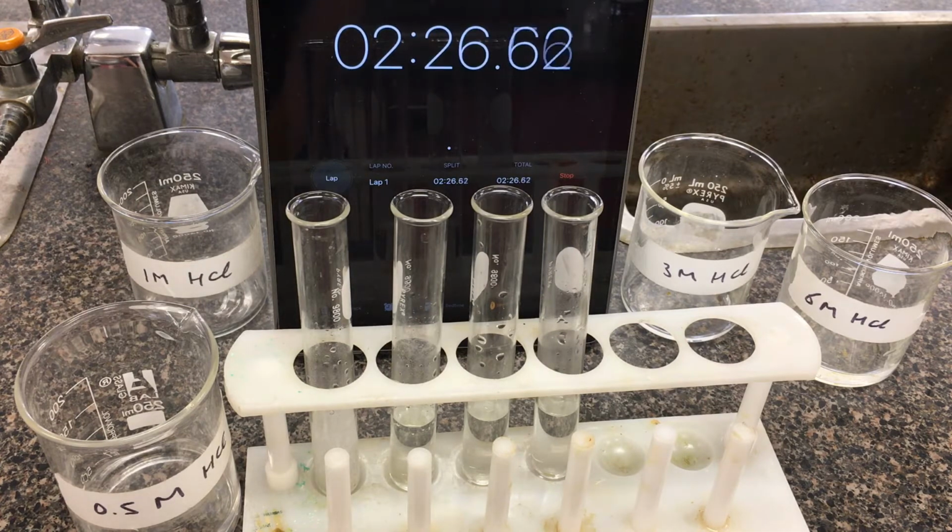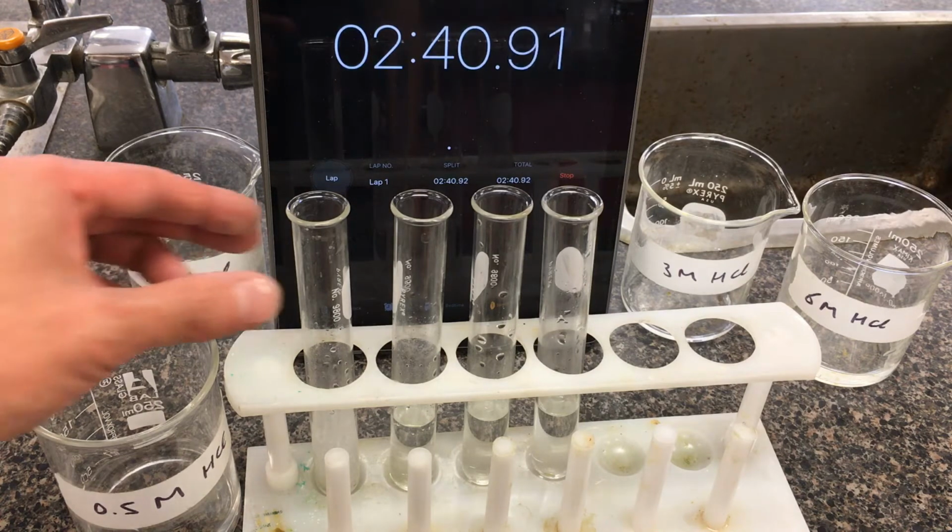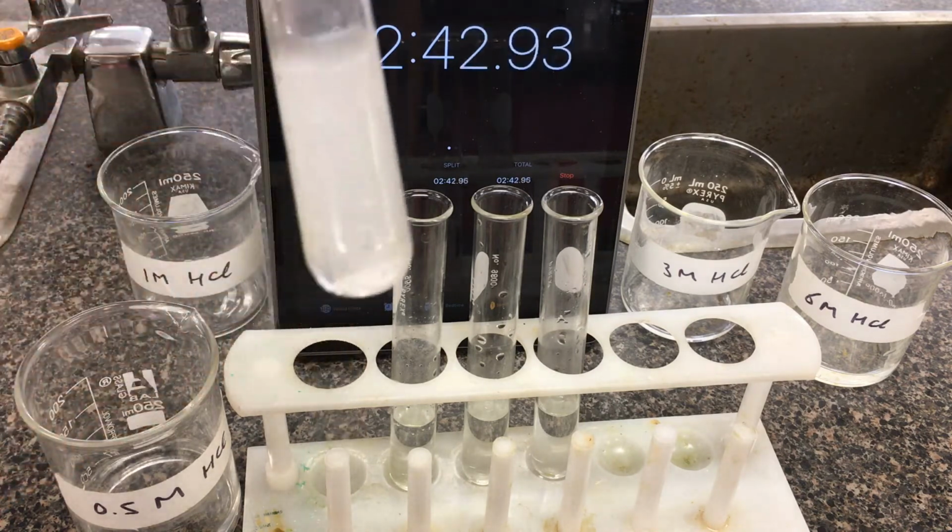We've chosen roughly concentrations that are double of each other. So 1 molar would be double of 0.5, 6 molar would be double of 3 molar. Nobody says the rate has to double, but that's one way to look at it here. If we have twice the number of particles, is the rate here twice as fast as it was initially?